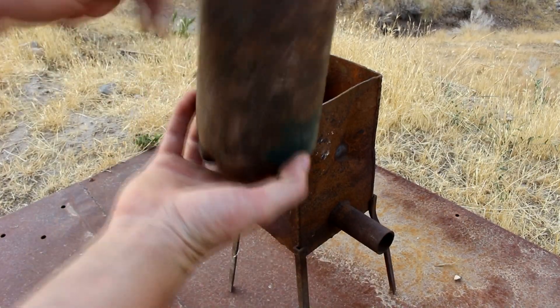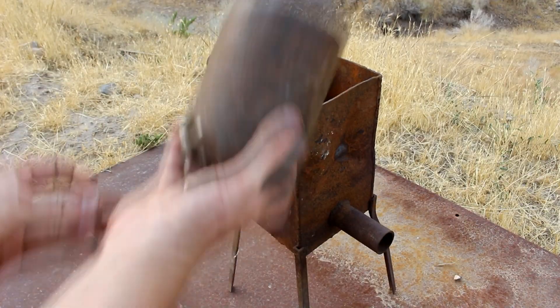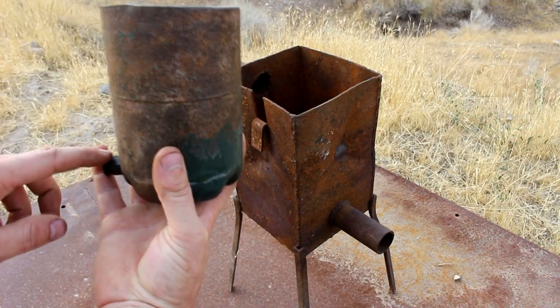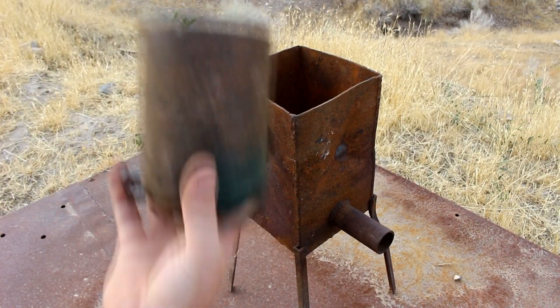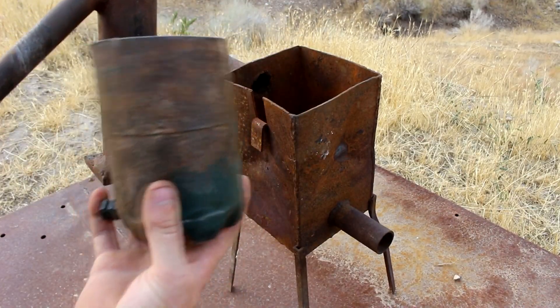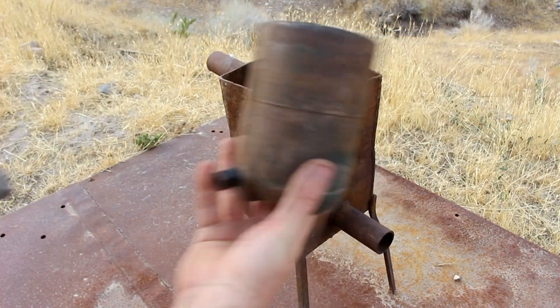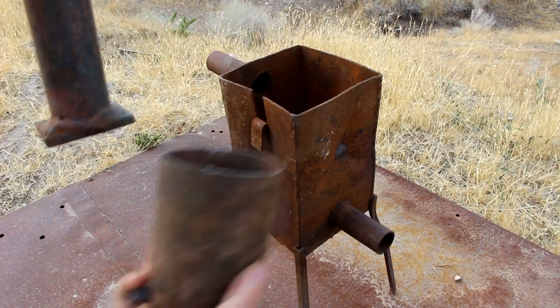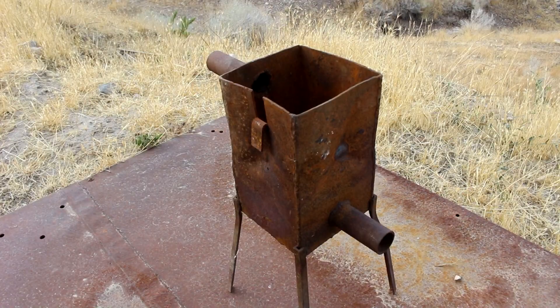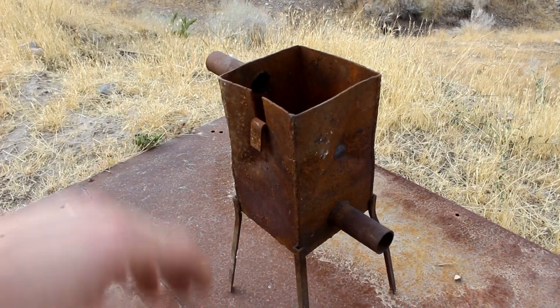This way I can have a vessel with an open top — maybe I'll put something over it — open to the atmosphere that I can weld this into. And just position this so that the mercury level in this matches the mercury level in here, about halfway up. So I have them set kind of like this but farther apart. That way when I put mercury in here, it'll flow through into the boiling vessel and get distilled. That's the idea at least. Hopefully I can do quite a lot of mercury this way. Let's get this thing welded together.